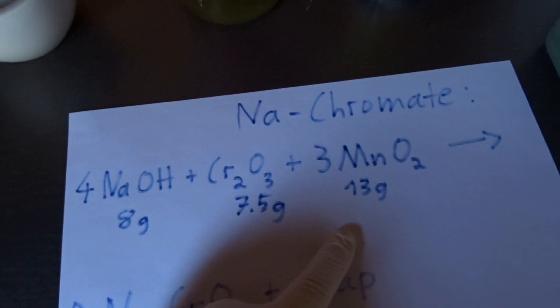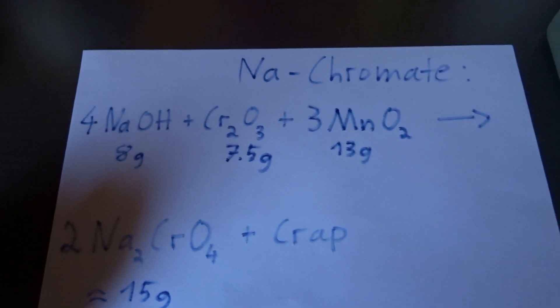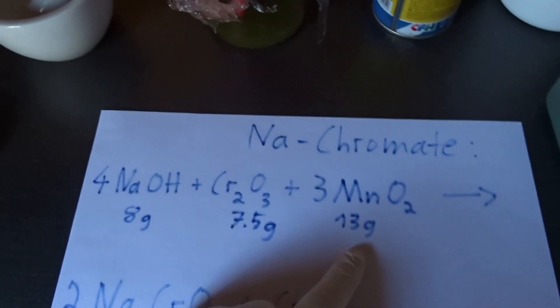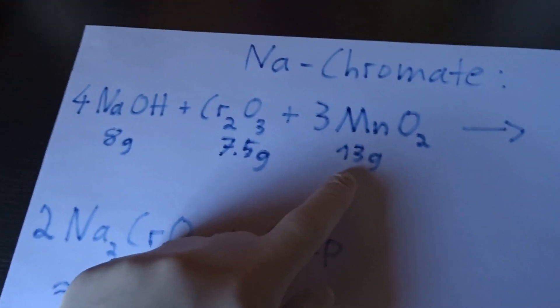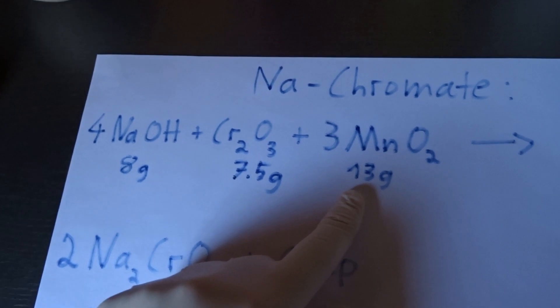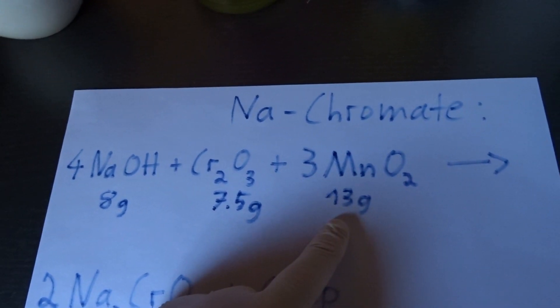So it uses sodium hydroxide which is available as a drain cleaner to every amateur I guess. Manganese dioxide. My manganese dioxide is store bought but you can also find it in batteries and there's a load of good videos on how to get it from a battery. In particular zinc carbon batteries.